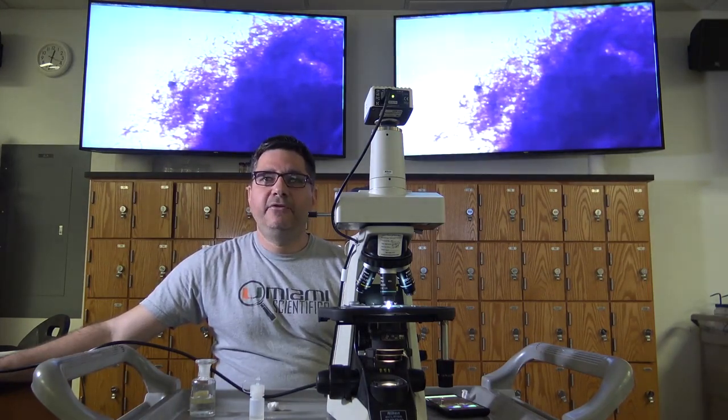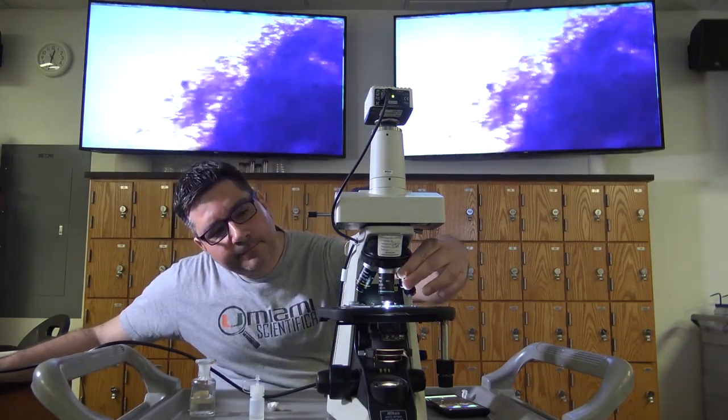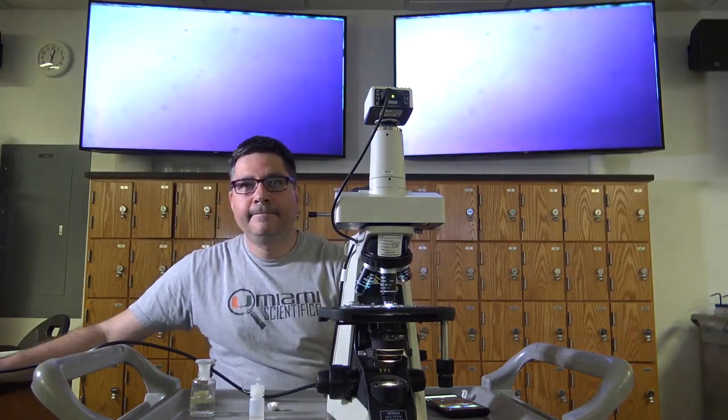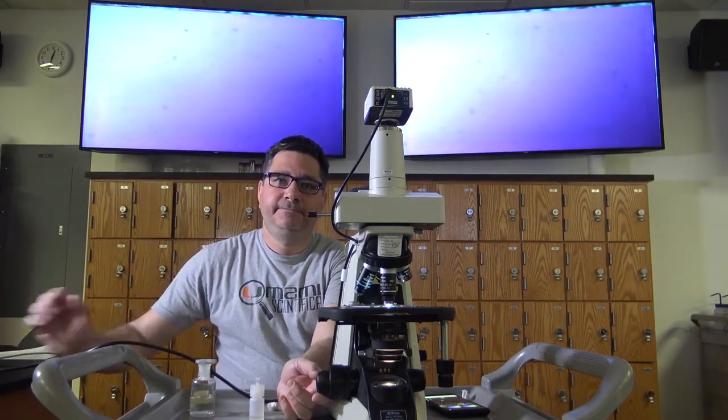Using the turret, dial your scope to the 100x objective, also known as the oil immersion objective. Find focus and adjust the diaphragm and condenser.